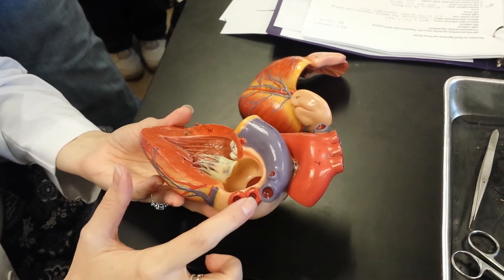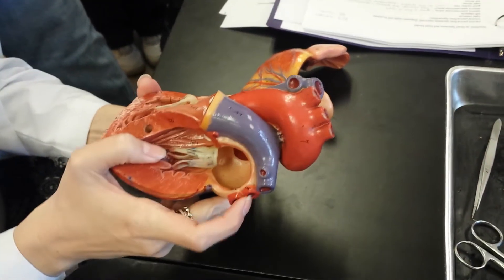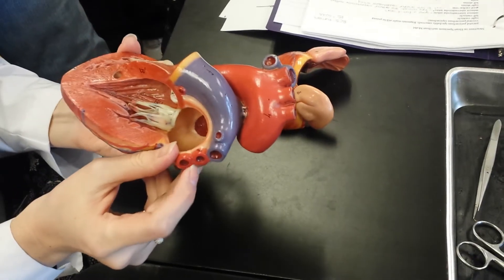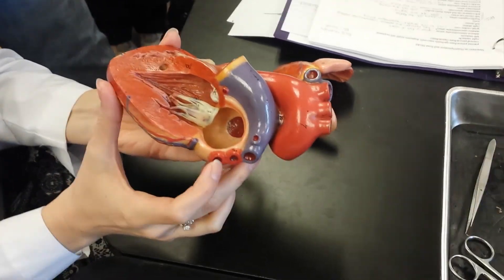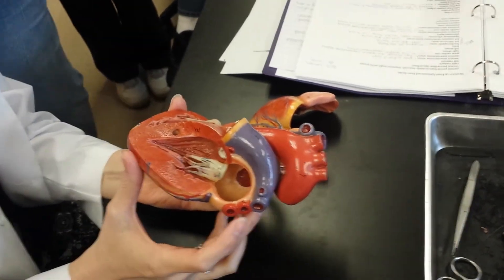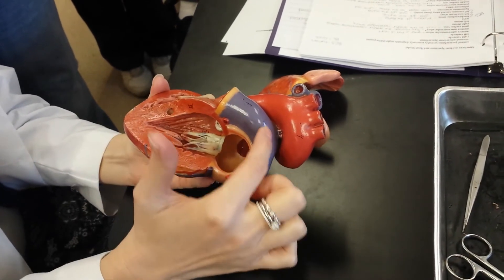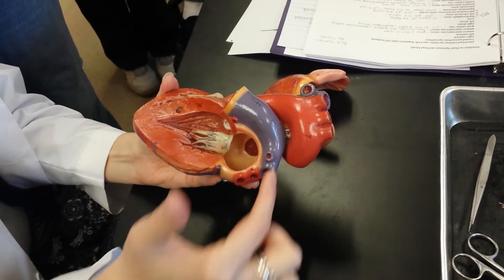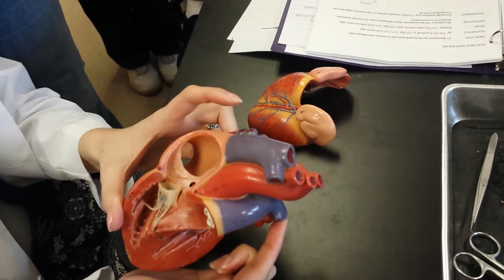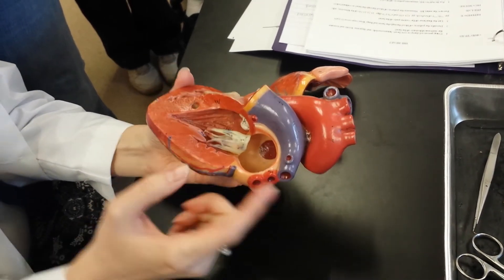What are these in red here? These are the pulmonary veins. Remember, this is the pulmonary trunk, which branches into pulmonary arteries here in blue, and these will be the veins coming back from the lungs shown in red.